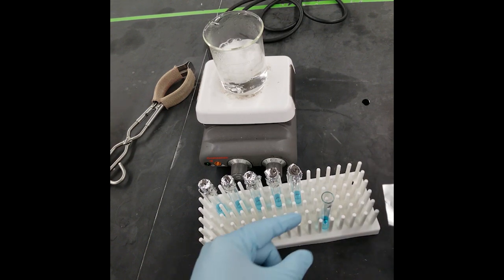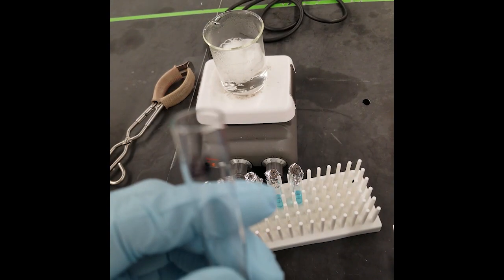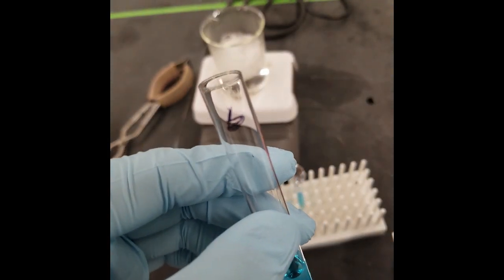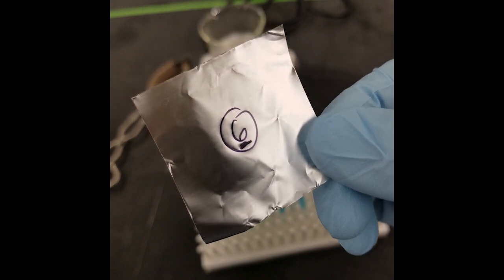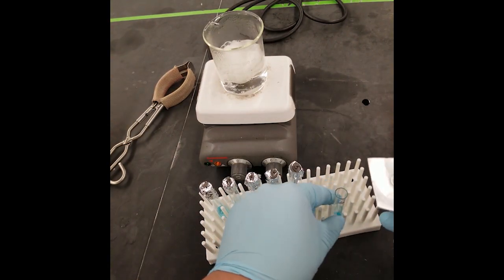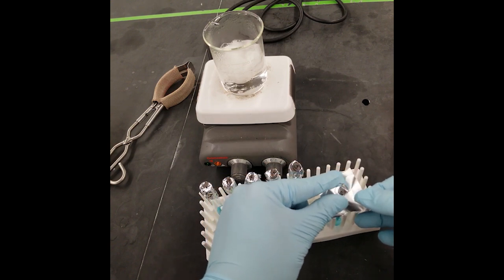For this video demonstration, I've only prepared the first six tubes used to generate the glucose standard curve with everything except the one ml of Nelson arsenomolybdate reagent. Note that I have labeled the tubes themselves, as well as a small piece of foil used to cover the tubes.